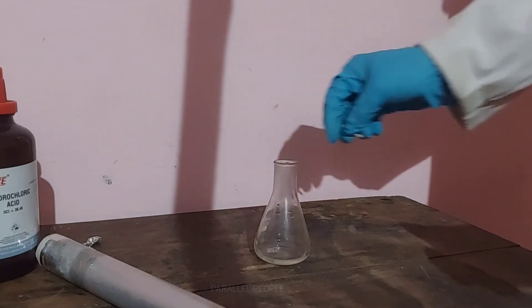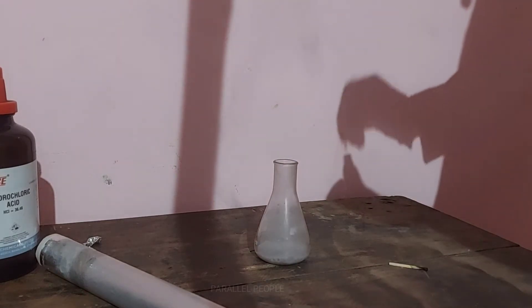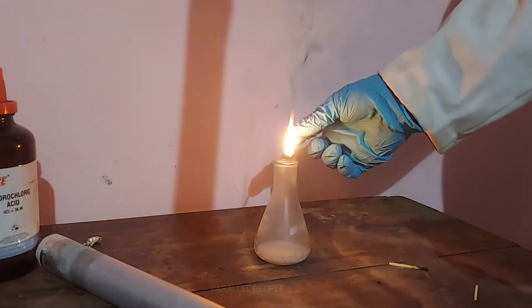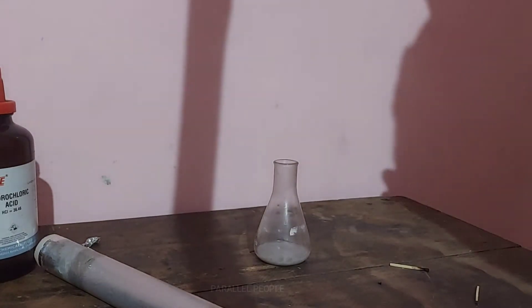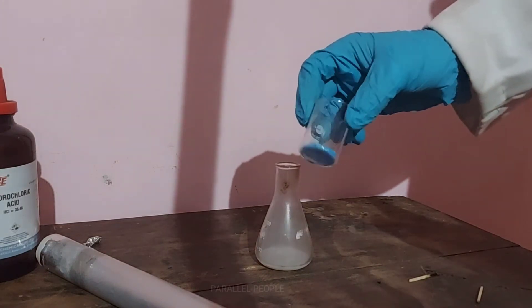Slowly you can see the reaction is going on, and suddenly it will accelerate as soon as the oxide layer of the aluminium is worn out and hydrochloric acid begins to directly react with the aluminium. It will become very wild. You can see the flame going. Now let us add some copper sulphate into the solution.